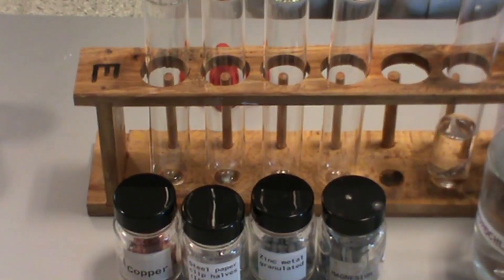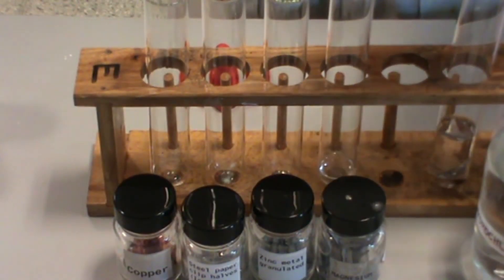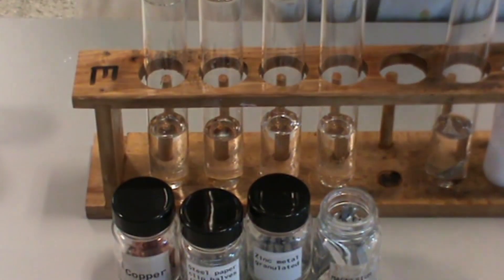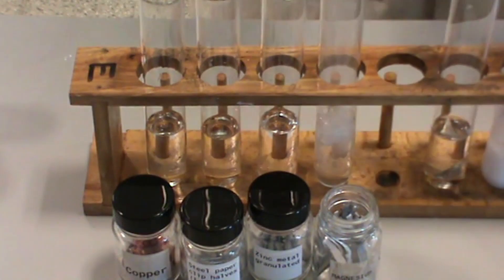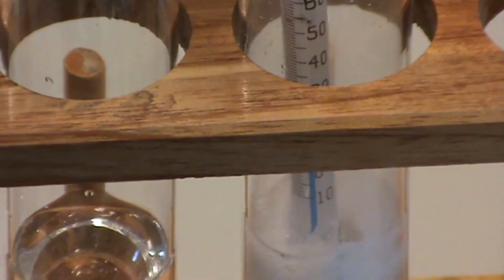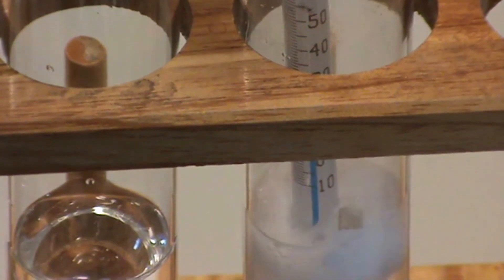We will now show the reactions of the remaining metals with hydrochloric acid. Magnesium and hydrochloric acid. The gas produced is hydrogen which should burn with a squeaky pop.